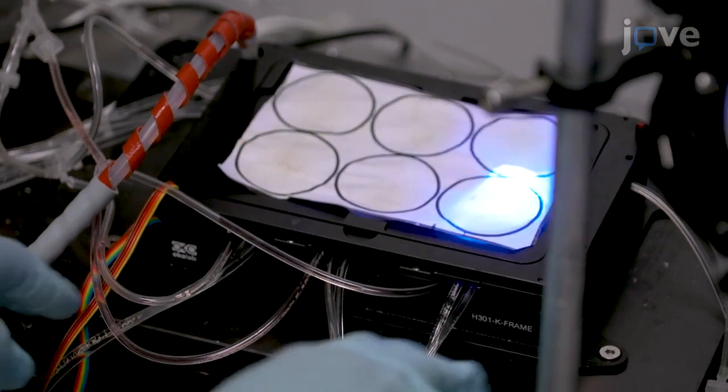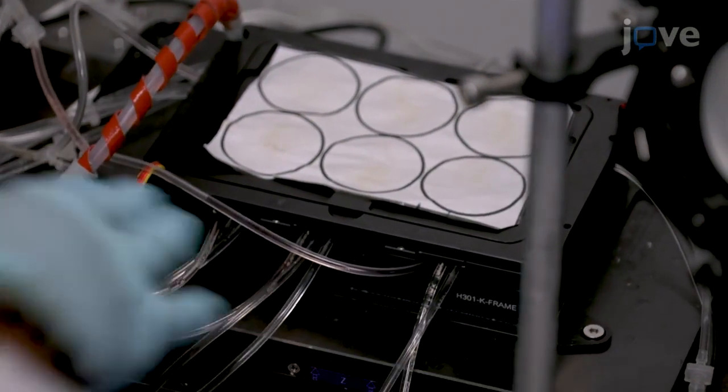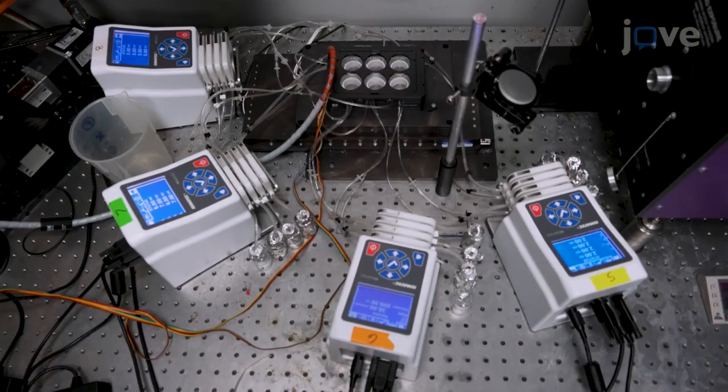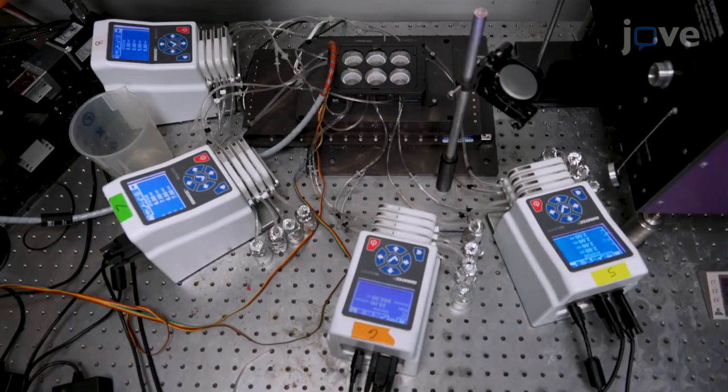The advantage of this technology is the use of an automated 6-well plate-based IC-FPOP platform that makes it possible to grow cells and perform in-cell FPOP studies right at the laser. This method can be used in pharmaceutical and biotech industries, as well as major academic and clinical research institutes, especially by biological investigators and universities studying protein dynamics.